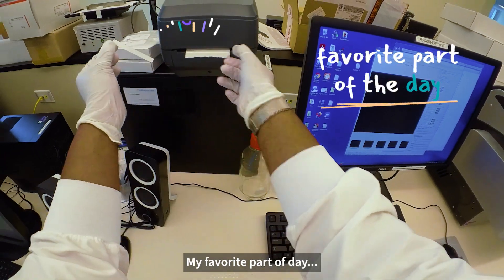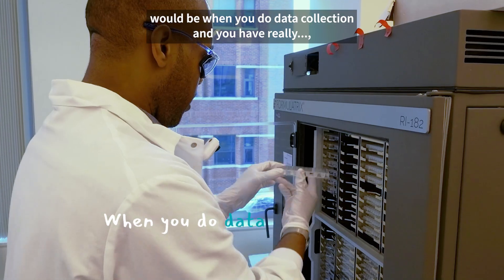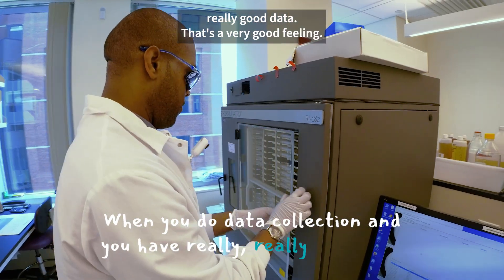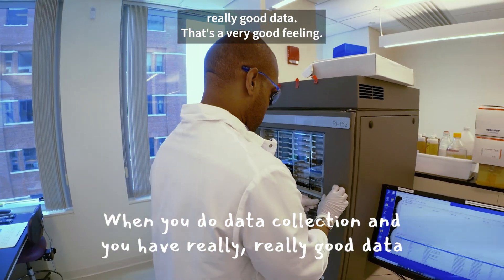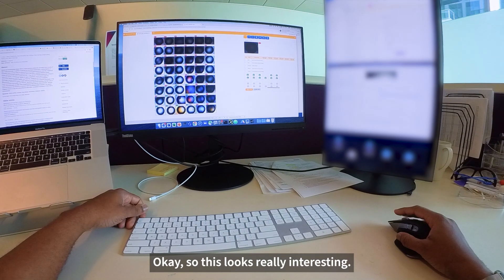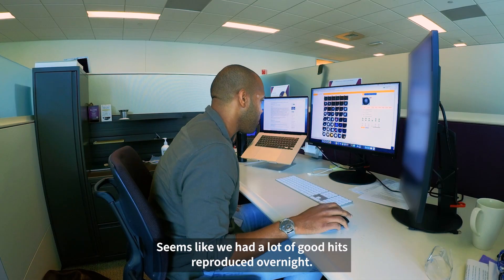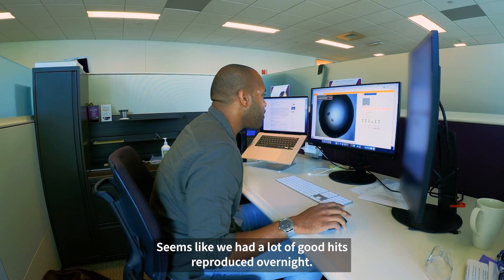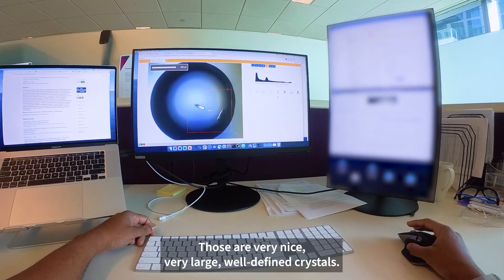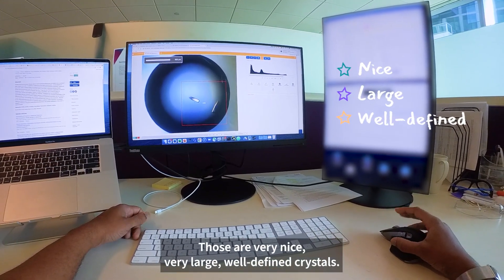My favorite part of the day would be when you do data collection and you have really, really good data — that's a very good feeling. This looks really interesting; it seems like we had a lot of good hits reproduced overnight, so that is exactly what we're looking for — very nice, very large, well-defined crystals.